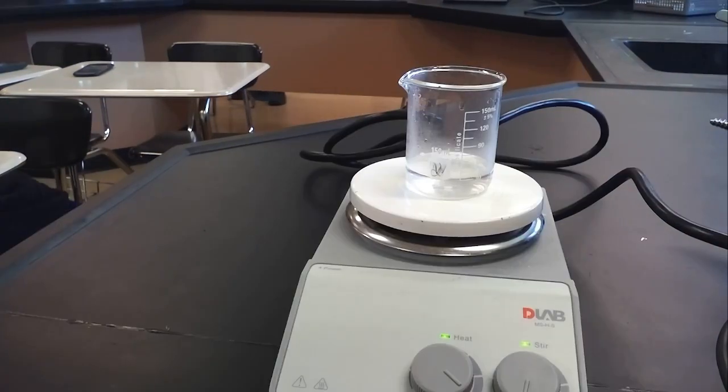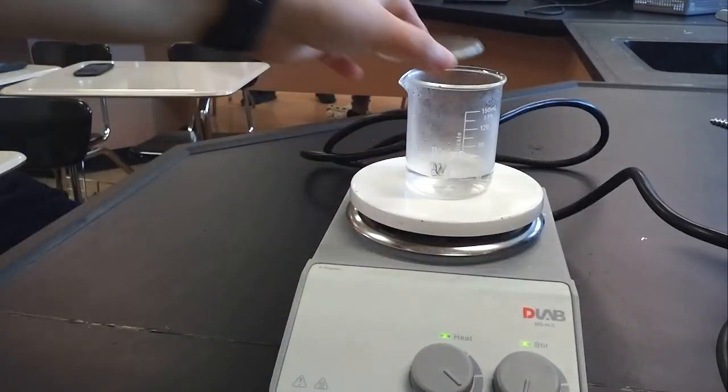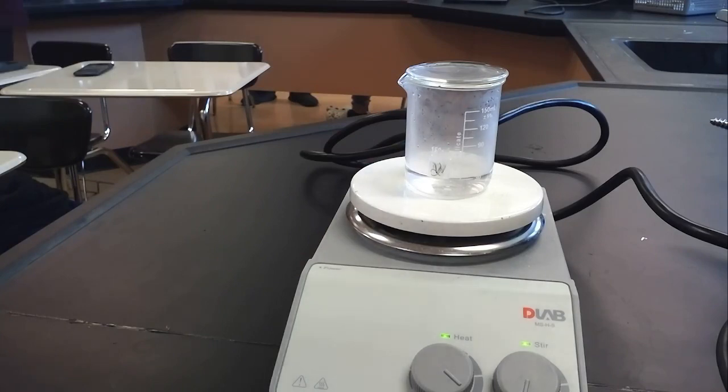I flatten the copper on the filter paper as I put it into the drying oven to increase surface area and help it dry faster. Meanwhile the AlCl₃ solution is on the hot plate — once it starts to boil, I'll place my watch glass on top. The reason for the watch glass is so that if the solution spatters, we collect it. Some students notice vapor escaping — that's the point, we're evaporating the liquid off to dehydrate the aluminum chloride solution. I'll pause the video and resume once a significant amount of liquid has evaporated.